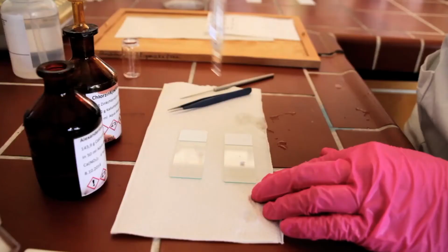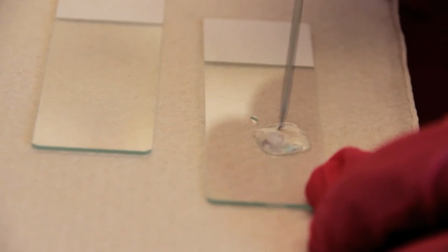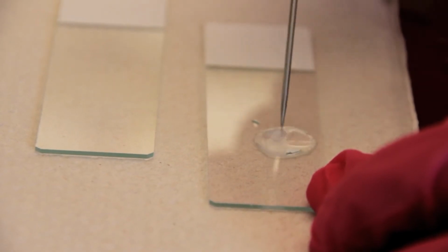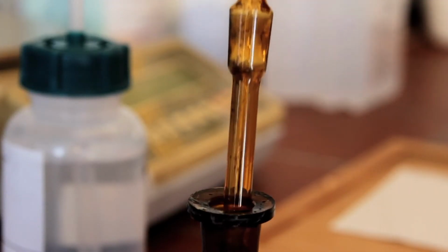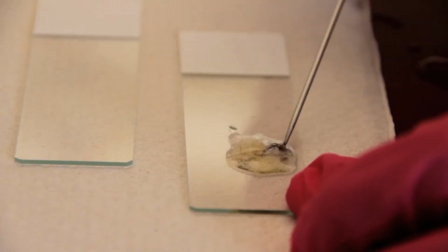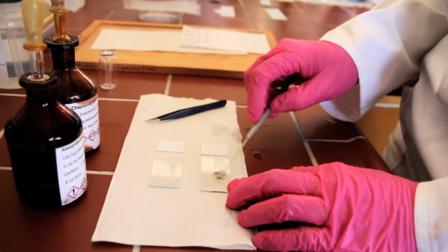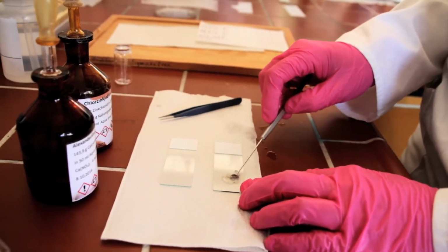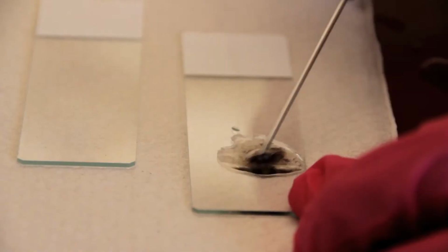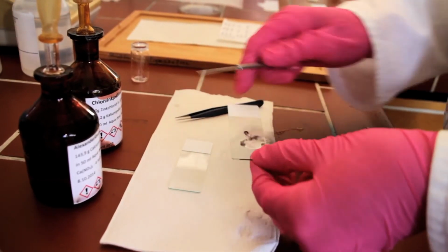First, put 2 drops of Alexander solution on the fibers and mix everything immediately with a preparation needle. Then add 1 drop of Herzberg solution, which is also immediately mixed well with all the fibers. It is important to mix the fibers with the solution immediately after dropping on. The fibers are then evenly distributed over the surface with the help of the preparation needle and careful tapping.